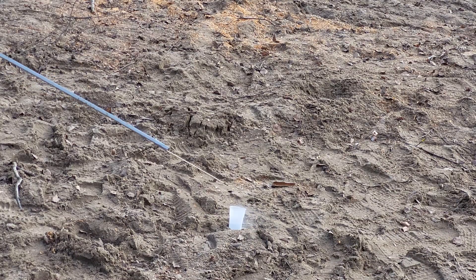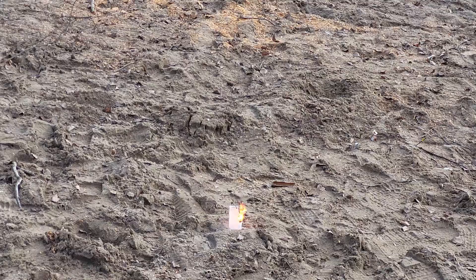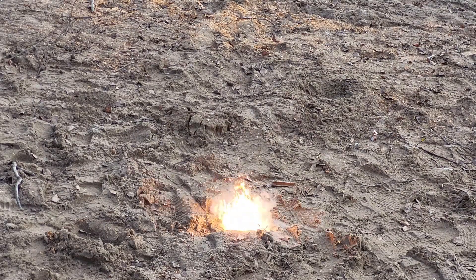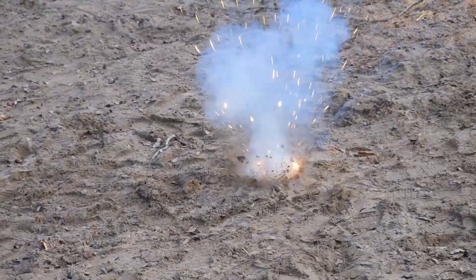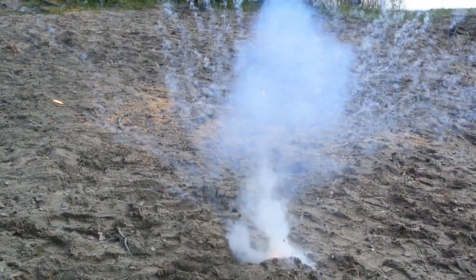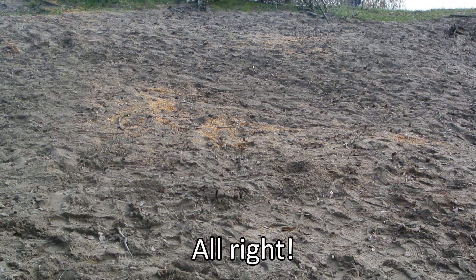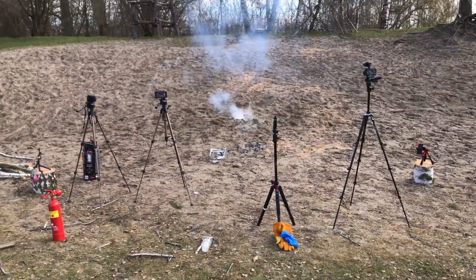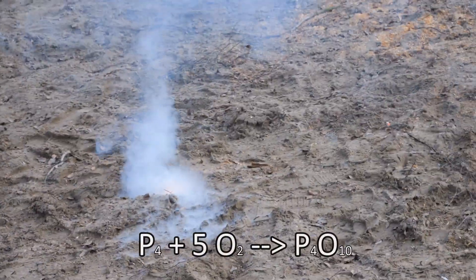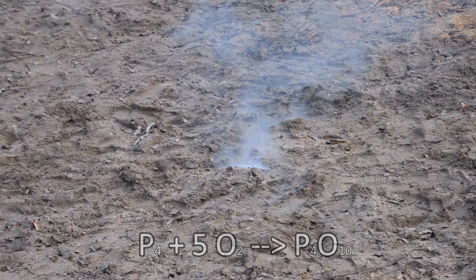When the reaction doesn't start in chemistry, it usually helps to give it a little push. So I touched it with a glowing splint, not expecting a lot to happen. We all ended up being quite surprised by the violence of the reaction. The reaction produces diphosphorus pentoxide, which is much more stable than the individual elements, and it would require a lot of energy to reverse this reaction.